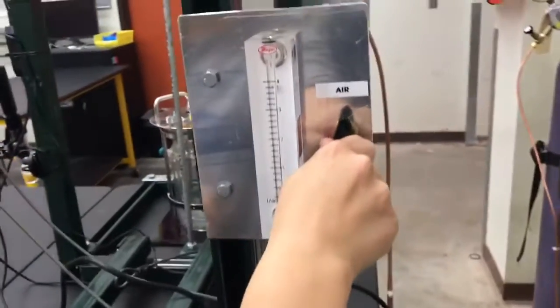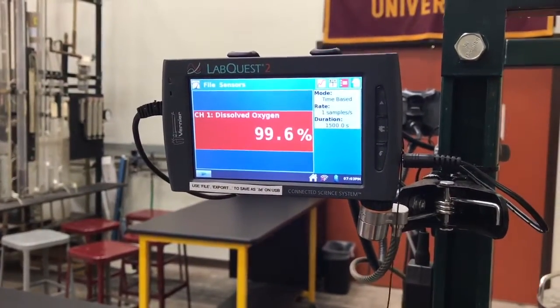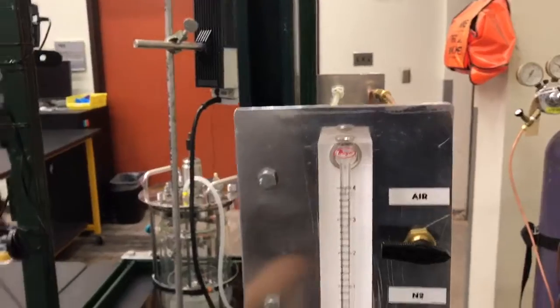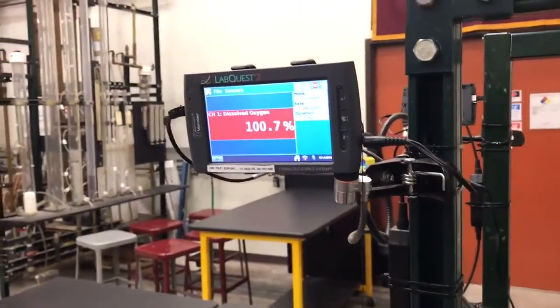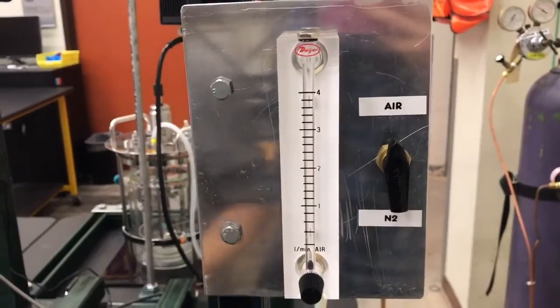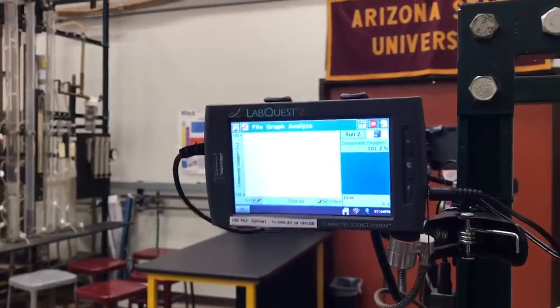Turn on the air to oxygenate the reactor and watch the dissolved oxygen level. Once it levels out, that is the maximum DO value achievable in this system. Then turn off the airflow and allow the yeast to consume oxygen to determine the oxygen uptake rate. Once DO reaches 25% of the maximum value, turn the air back on — going lower will kill the yeast. Wait until the plot levels out again; that is when the run is done.